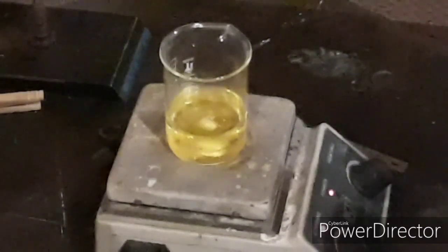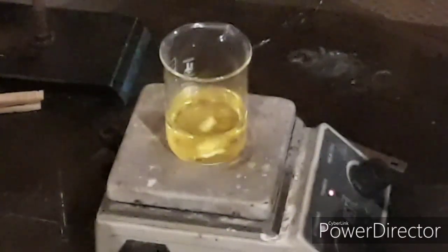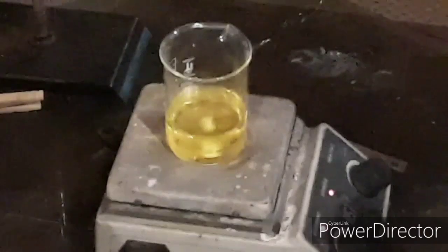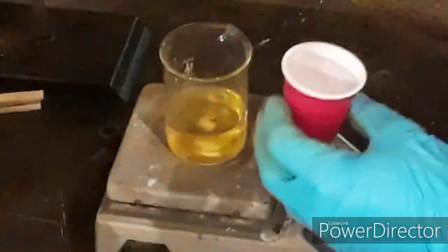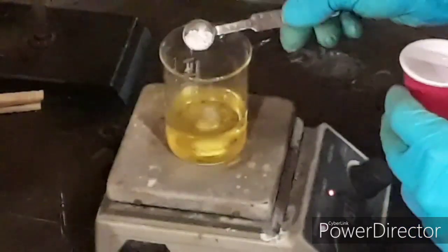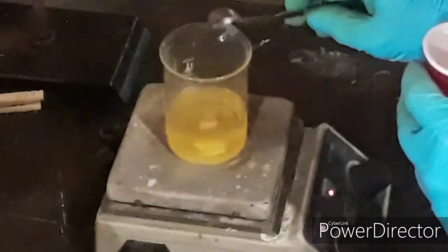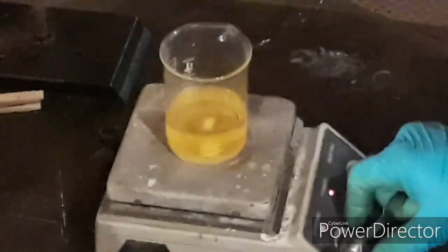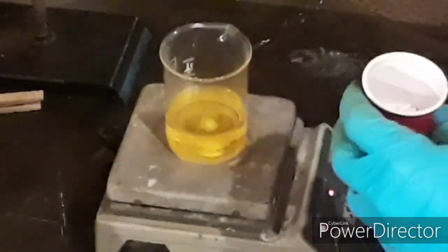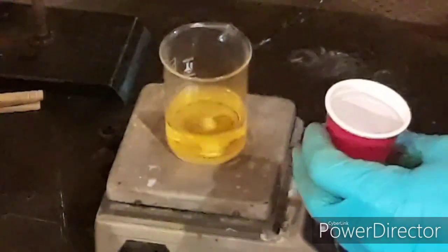The reason I chilled it is to control the foaming and the release of carbon dioxide. Chilling the acid slows the overall reaction while mitigating the CO2 release, so hopefully the reaction doesn't foam over. We just take a spoon and add it in slowly. There was a little bit of foaming that occurred — that is basically the release of carbon dioxide as it hits the acid, deprotonating the calcium carbonate.